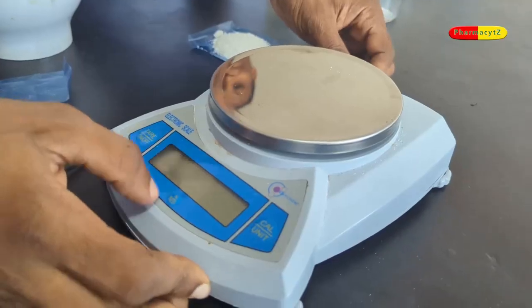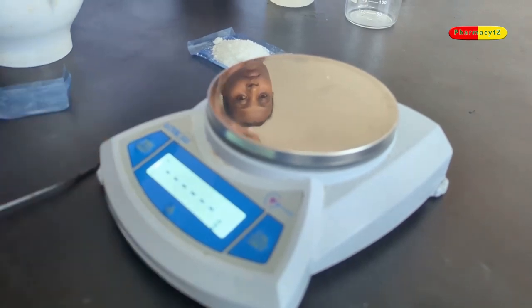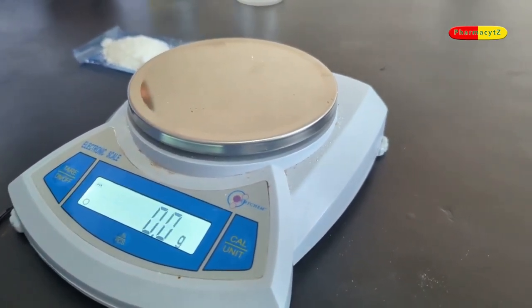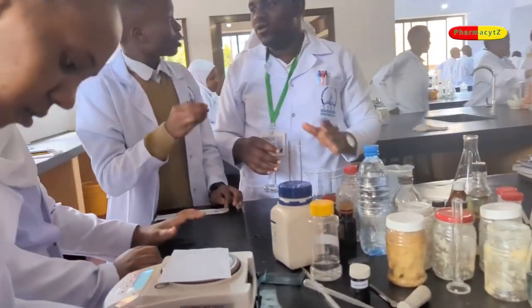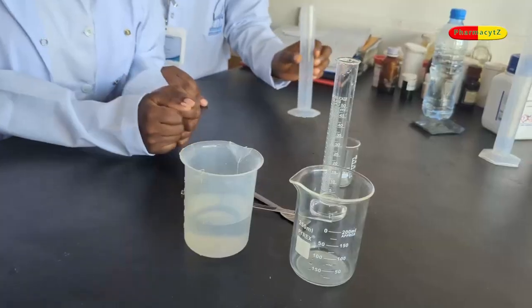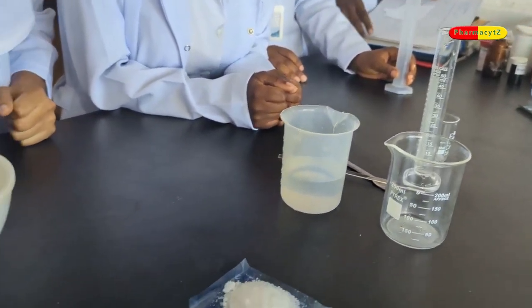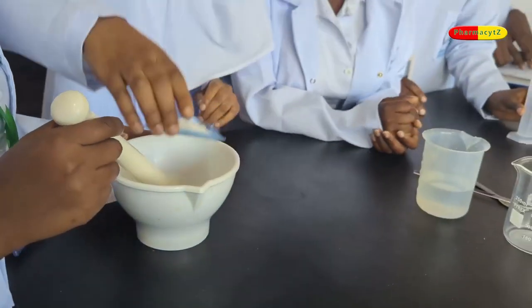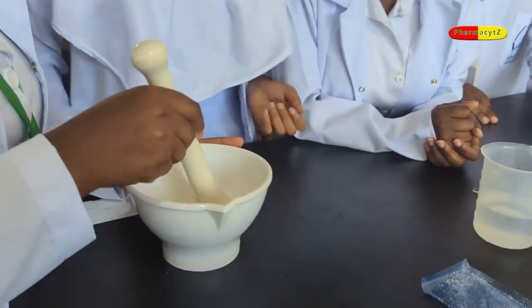Benzoic acid is a white solid organic compound whose structure consists of a benzene ring with a carboxyl group. In this short video, we are going to look at how students struggle to make benzoic acid solution. Most students find it harder to bring about benzoic acid solution. This is because of the techniques required to bring it forth. Most problems arise from its solubility.